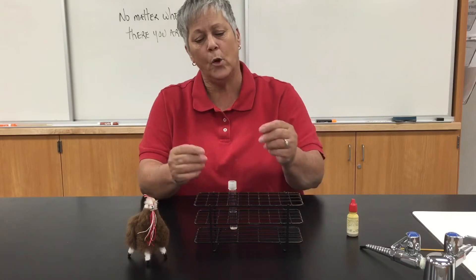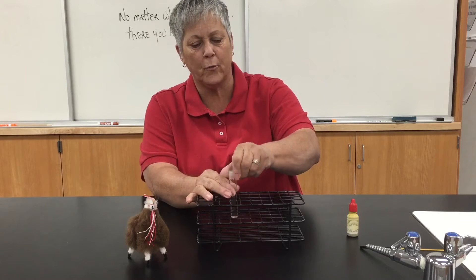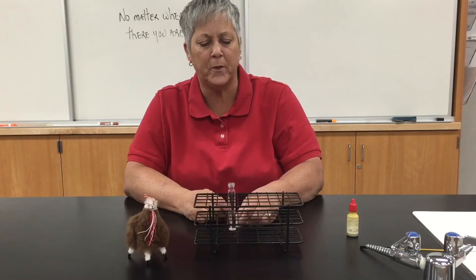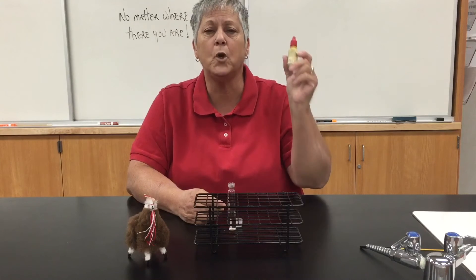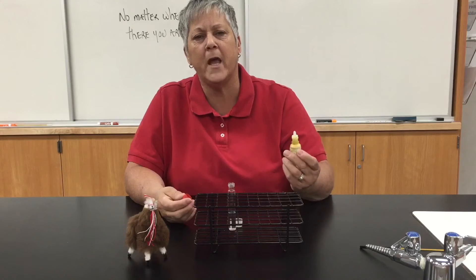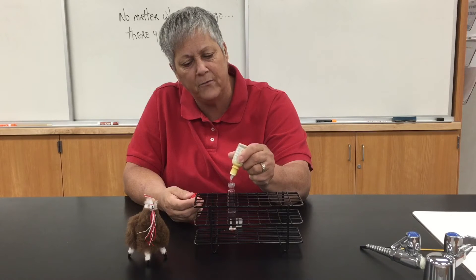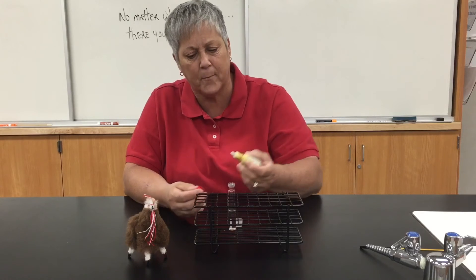When you come back, you would have gloves and a coat on. You would remove the cap from the tube — not really worried about contaminating the experimental tube at this point, because we're going to autoclave it when we're done. I would add some Kovacs solution, about a quarter inch layer, to the broth without touching the tip of the bottle to the tube, holding it just above. The Kovacs will float to the surface of the broth.